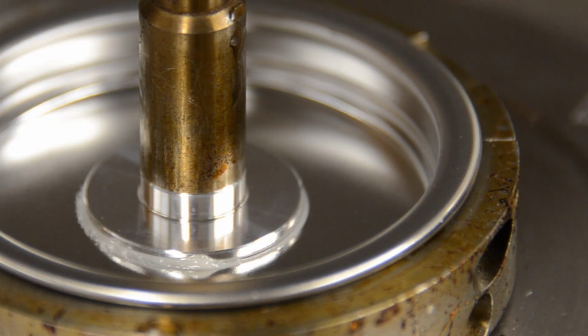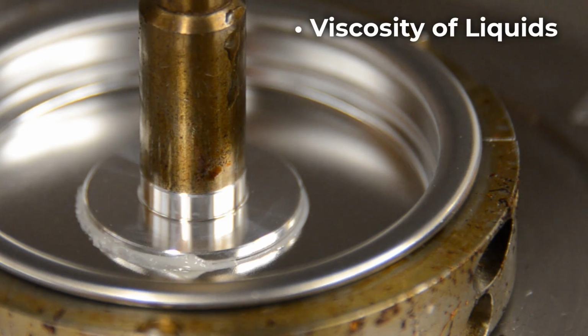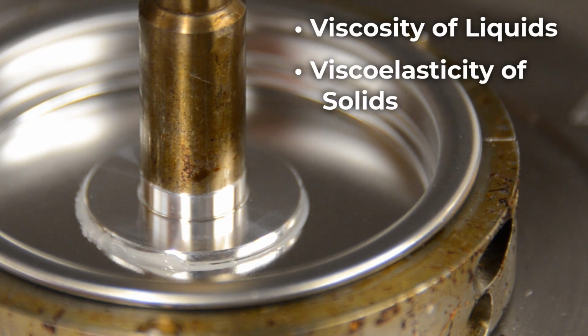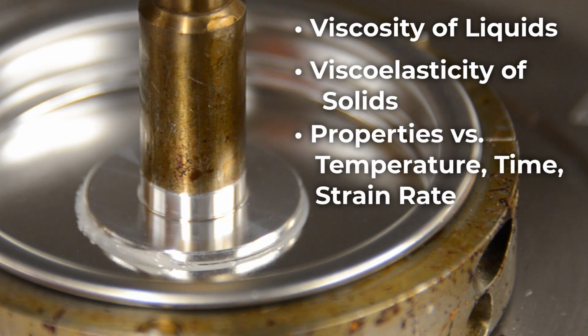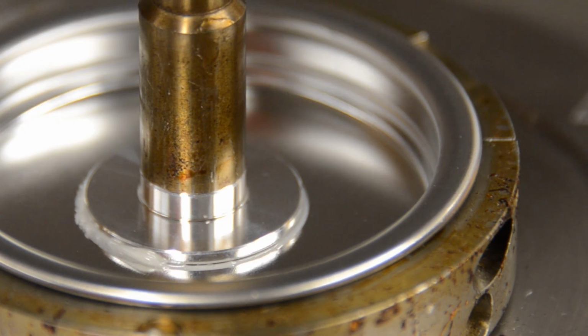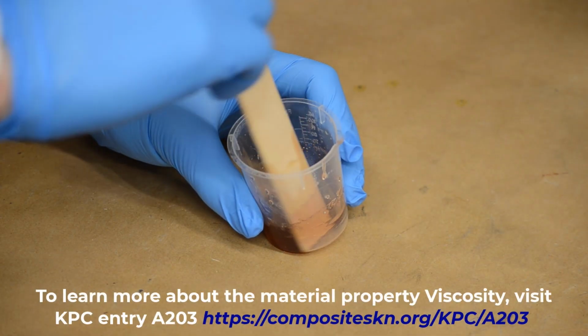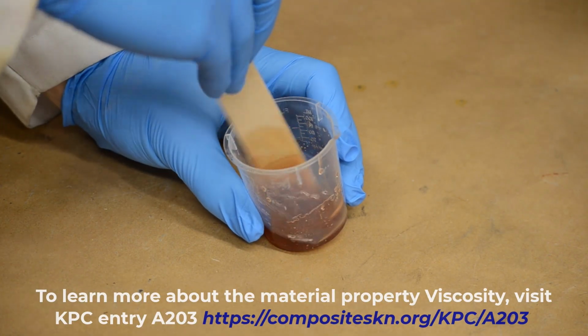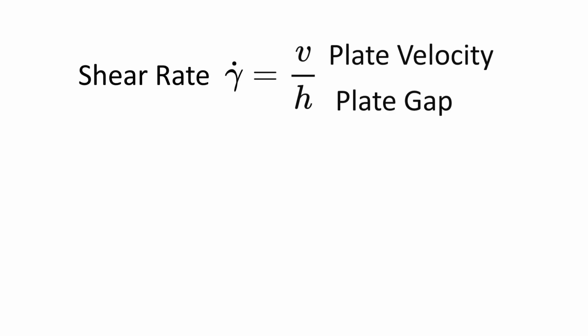Some examples of material properties that can be measured include viscosity of liquids, viscoelastic properties of solids, and the influence of temperature, time, and strain rate on these properties. Viscosity is a measure of a fluid's resistance to shear deformation. Fluids with high viscosity will require more force to deform at a given rate. In the context of a rheometer, strain rate, or more specifically shear rate, is defined as seen here.